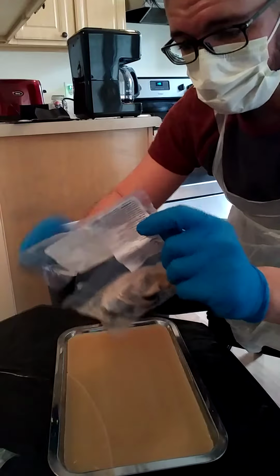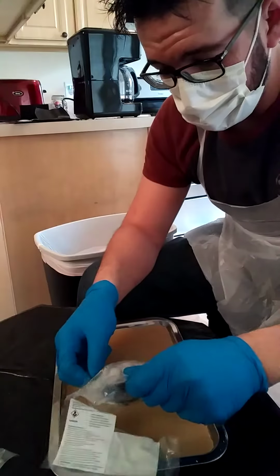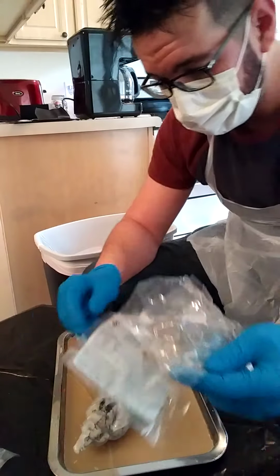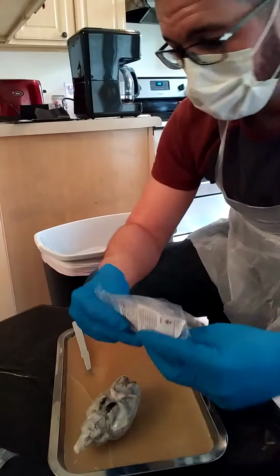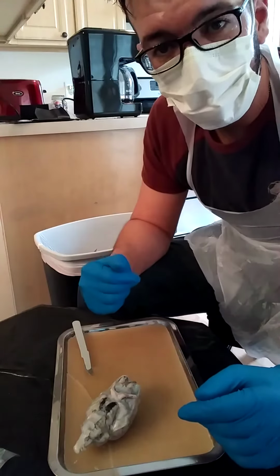That was fast. All right, there we go. And it looks all brainy and stuff. It's just going to get immediately thrown out when I'm done with it.